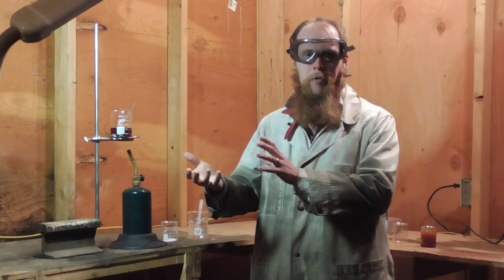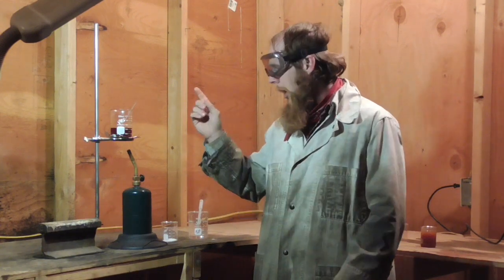I'm sure there are plenty of videos on YouTube about soap making, so I'm not going to rehash the process of making soap from canola oil, but what I am going to do is try it with this sulfurized canola oil and see if it works and see what the end product is like, if it works at all.